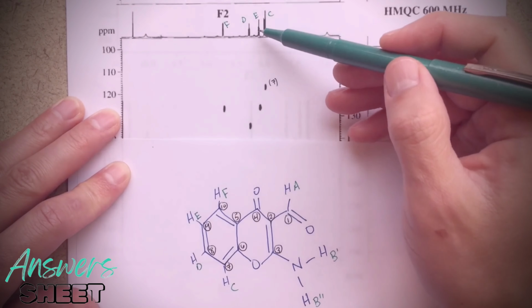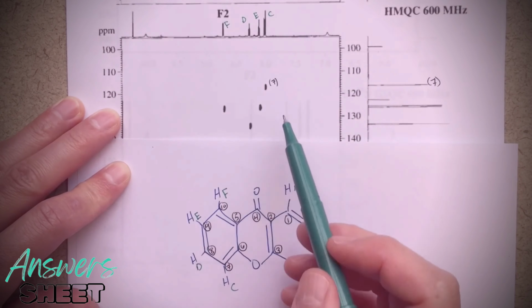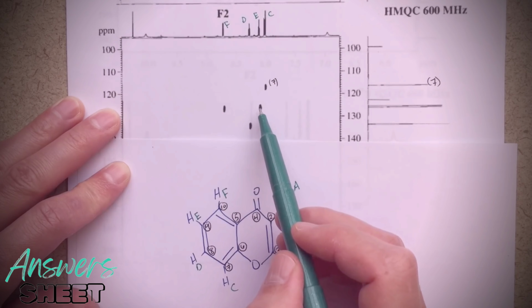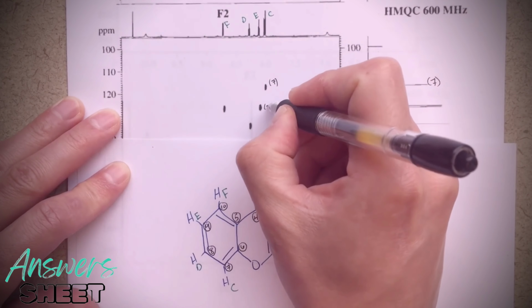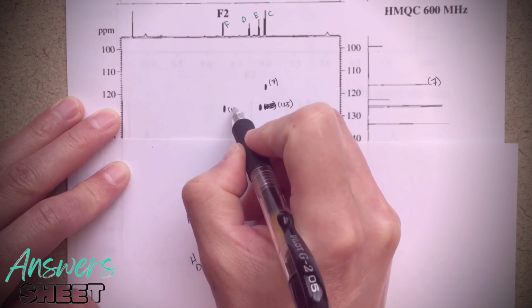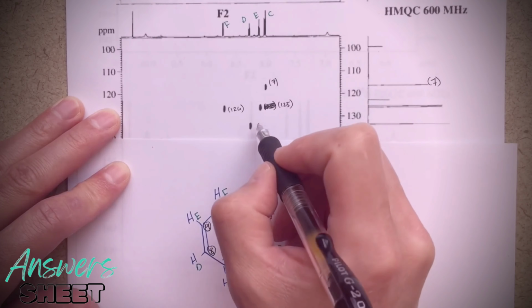Now for E, that corresponds to this proton and carbon number 9. If I look at this, these two carbon peaks are very close to one another. I looked very closely at these, and this one looks to be slightly higher up, a little bit higher than this one over here. So I said that this one was probably the 125. Let's make it legible. And that this one was the 126. And then this peak here comes at 134.